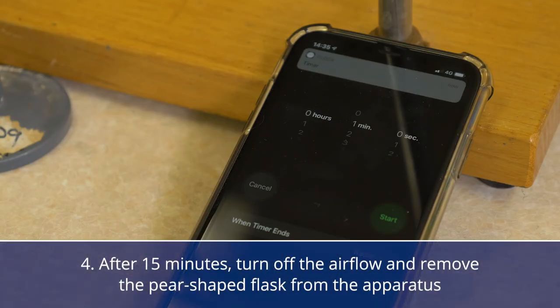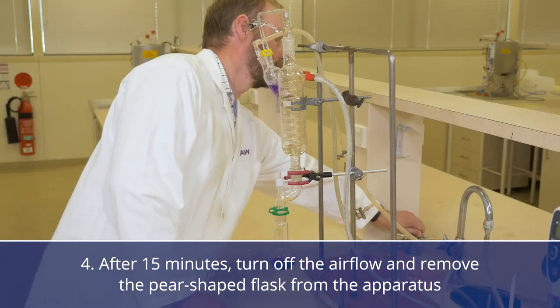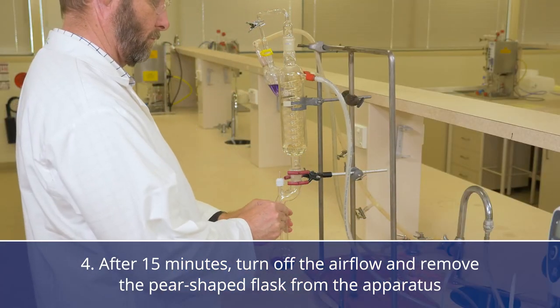After the 15 minutes has finished, turn off the airflow and remove the pear shaped flask from the apparatus.